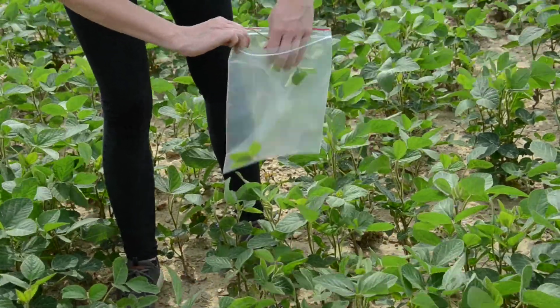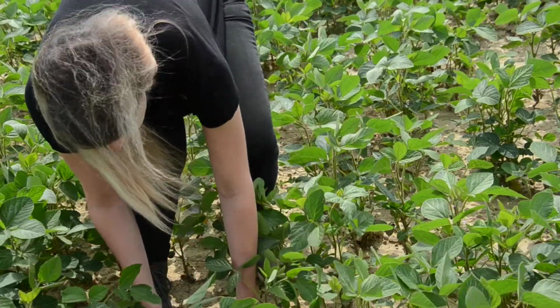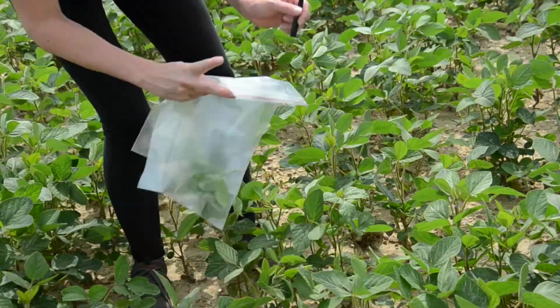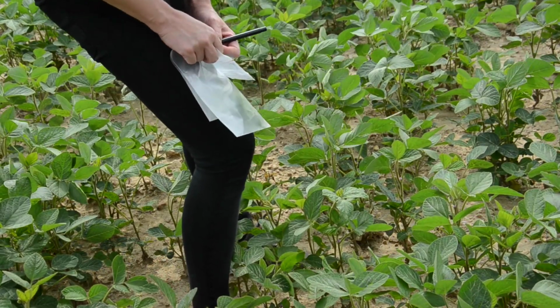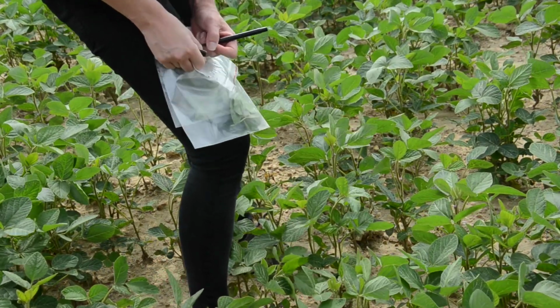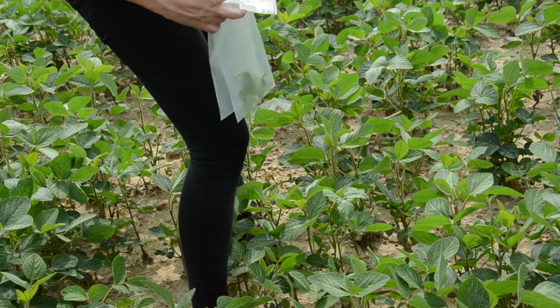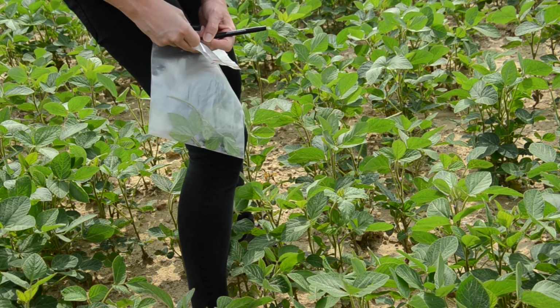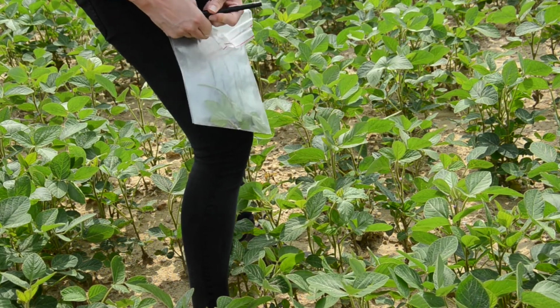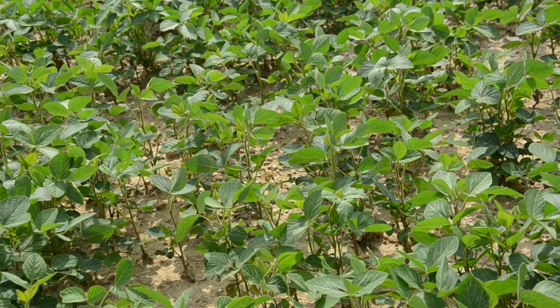The collection should be approximately the same distance to each other and span through the field. Basically, we are just interested in the petioles of the leaves. The samples must be labeled immediately and placed in a cool box. They should be prepared and measured within 3 hours. If the sample dilution has been made, the samples can also be stored in the freezer until the next day. But important is, the dilution must be already made.